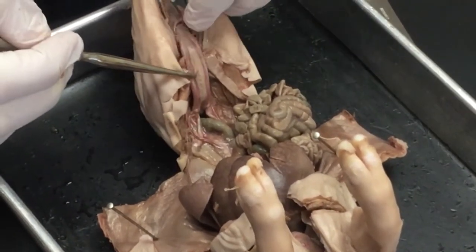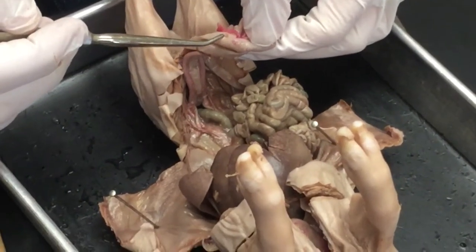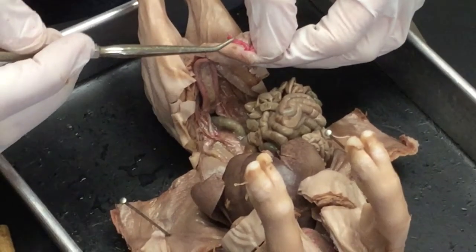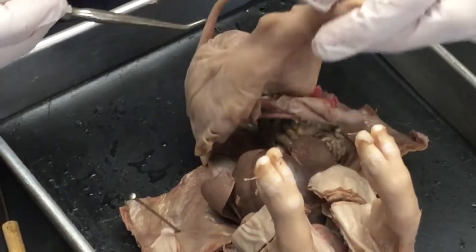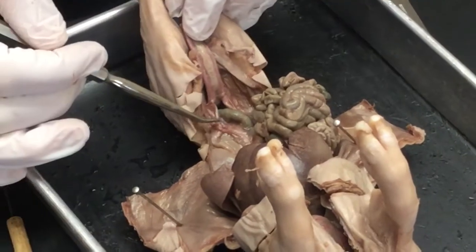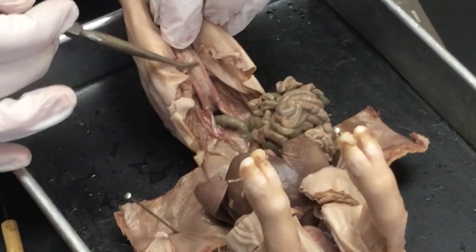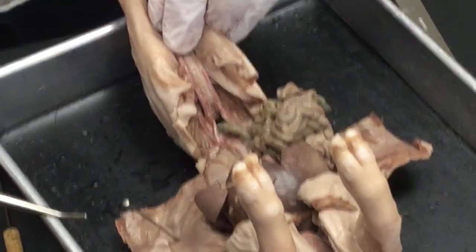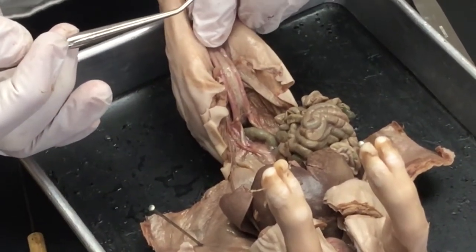Now, that bladder is going to hold urine, and the urine is eventually going to be released out of the urogenital sinus. You remember in the female, the urogenital opening was below the urogenital papilla, but the male doesn't have that. So that would lead us to think that the ureters leading to the urinary bladder, we should have the urethra here somewhere. So we're going to locate the urethra in this situation as well.